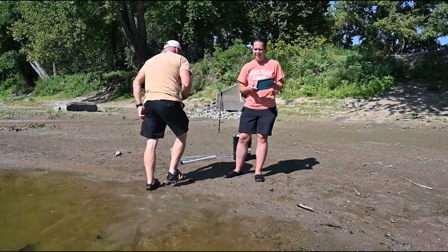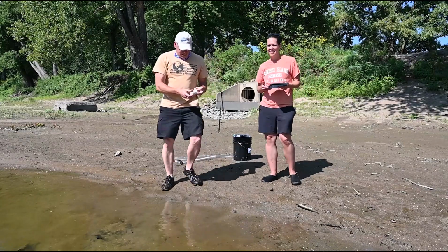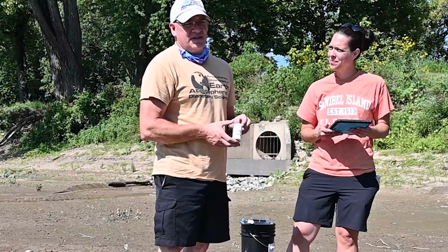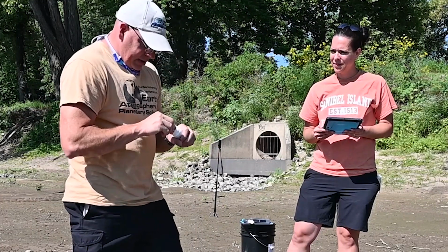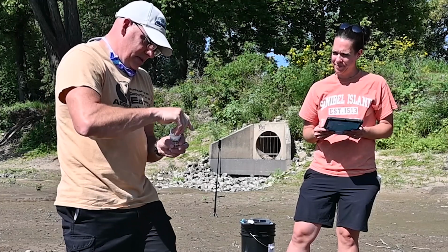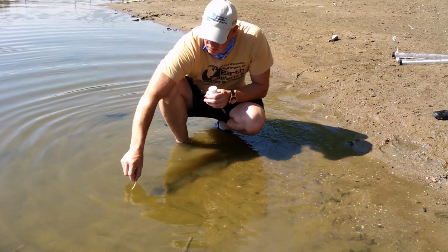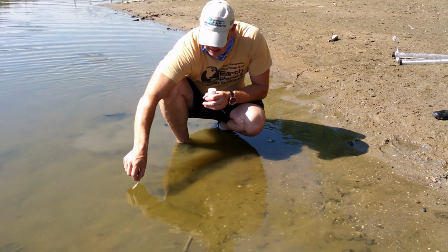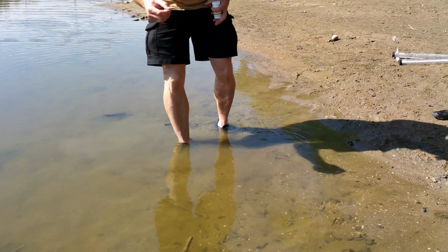But we're not done because sometimes you don't have the probes, right? Some people don't. And what we always used before that was test strips. There's all kinds of test strips that different programs use. This test strip is just a little bitty piece of plastic that has something on it. And what we have to do is put it in the water for 10 seconds, waving it around. The little pieces on there have something called an indicator, and the indicator changes color with a pH change. You keep it out for 20 seconds.